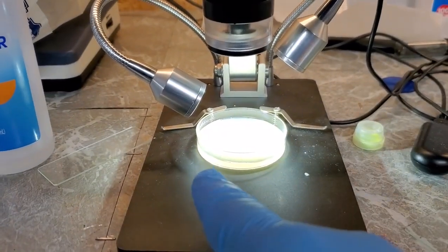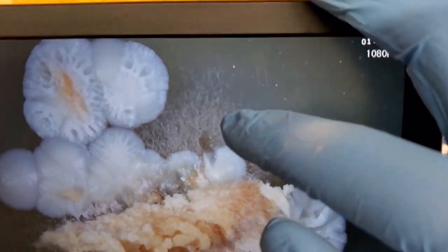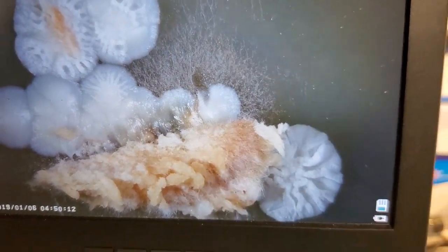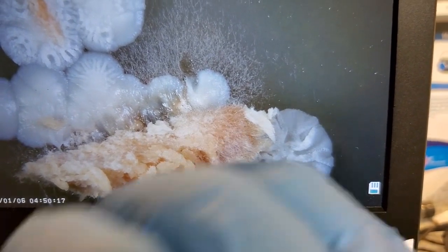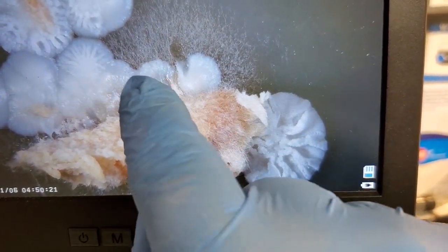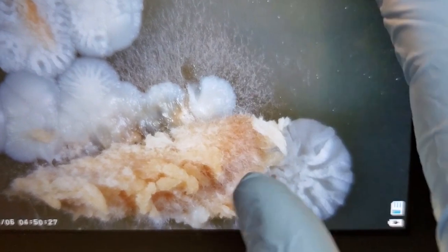Okay, I have the petri dish underneath my little microscope here with the LCD screen on. Now you can see things a lot easier, and I can actually point to things without damaging the colony. While I was moving this over to the microscope, I went to put the lid back on the petri dish, and I bumped this piece right here, so it smooshed over to the side a little bit. But everything's still very visible and easily discernible, so it's not really that big of a deal.